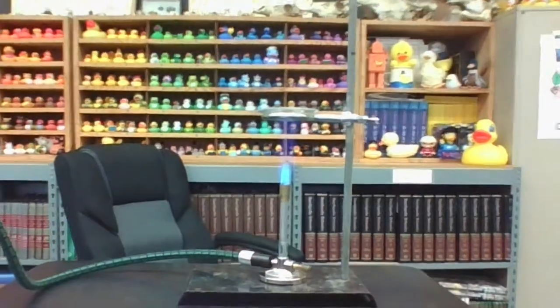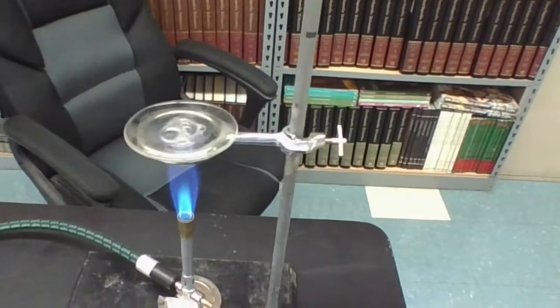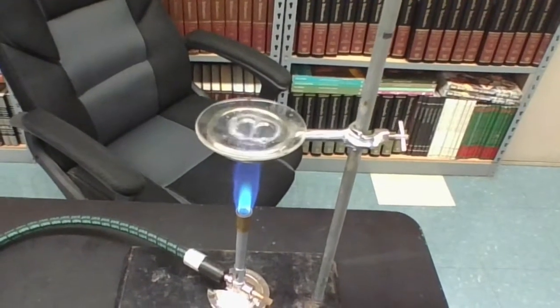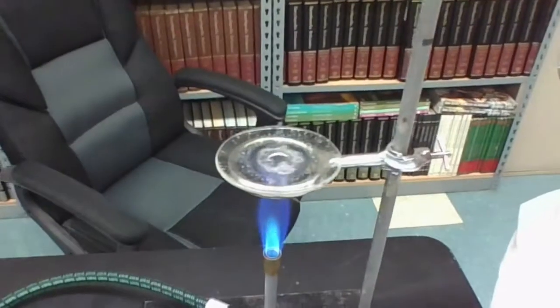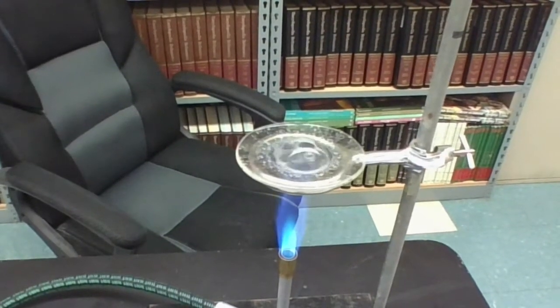Now, to help you observe a little bit better, I am going to pick up the computer so that you can actually get a close-up view of what is happening on top of the evaporating dish. Hopefully you can see that right now. The liquid is quickly evaporating. It is bubbling away like mad. And now I'm going to allow you to make some observations. You can listen. I'll try and hold this steady so you don't get dizzy. Listen and watch for the next couple moments here.